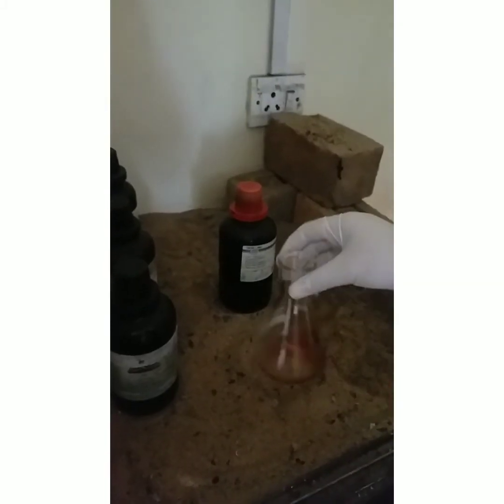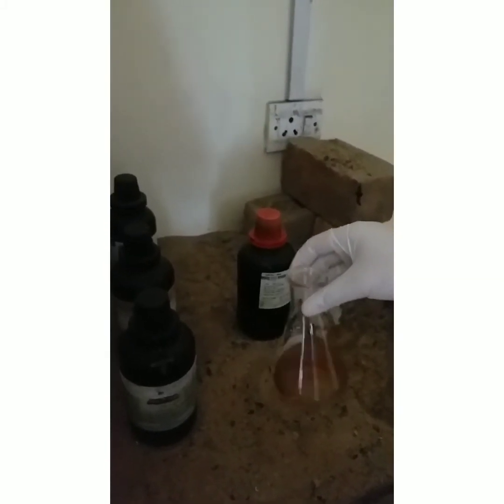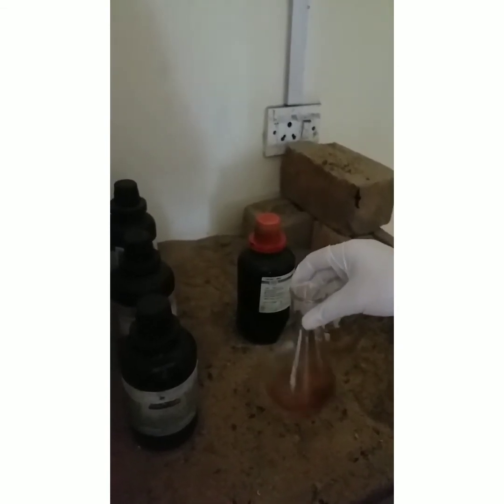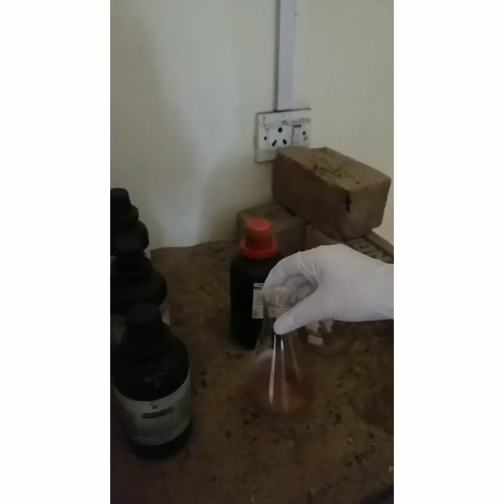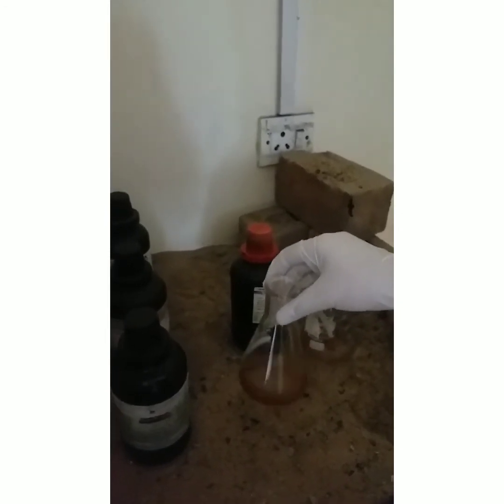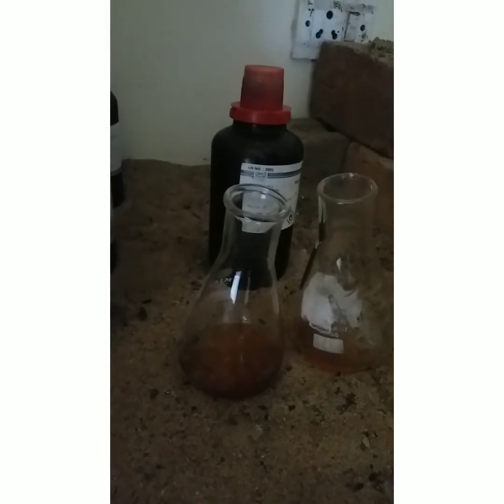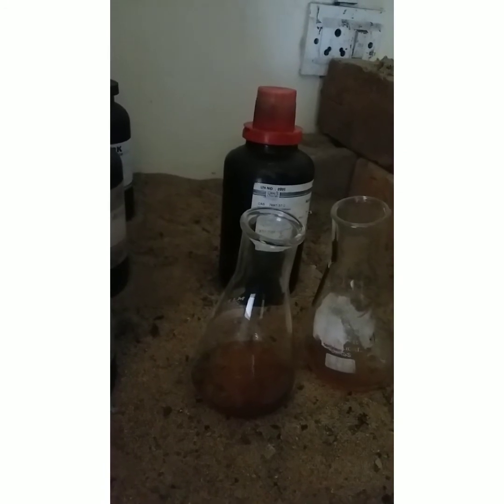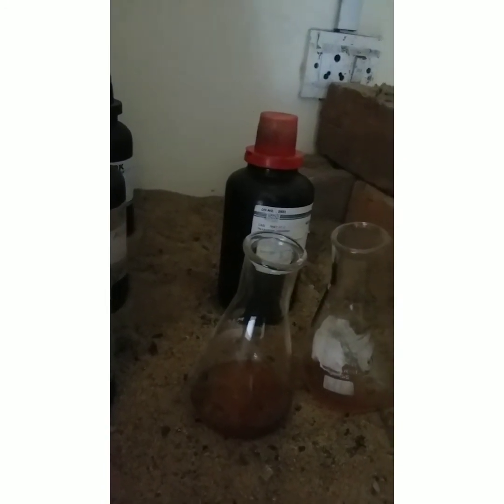Remember that preparation should be conducted in a fuming chamber. The colour of the precipitate is orange due to excess bromine. Allow the reaction to stand at room temperature for 15 minutes with occasional shaking.